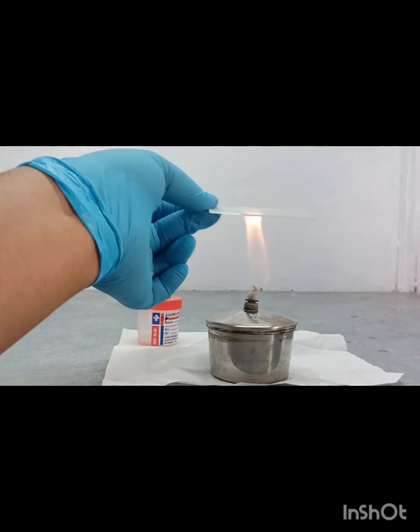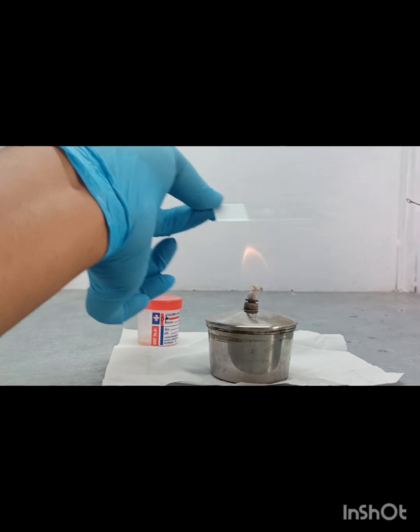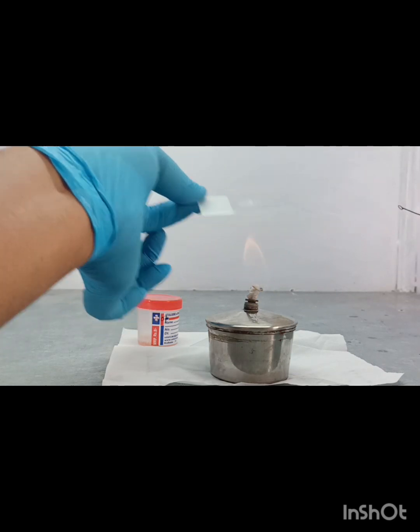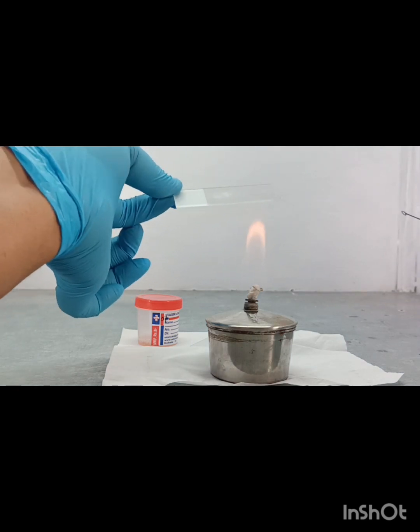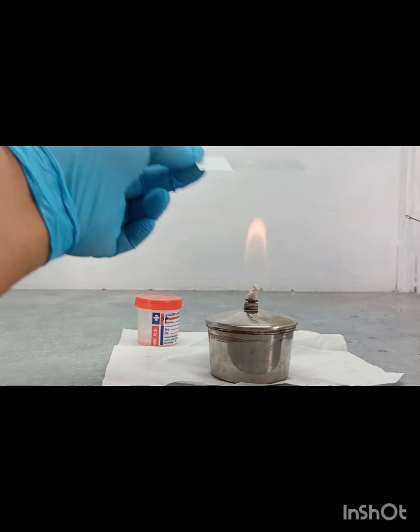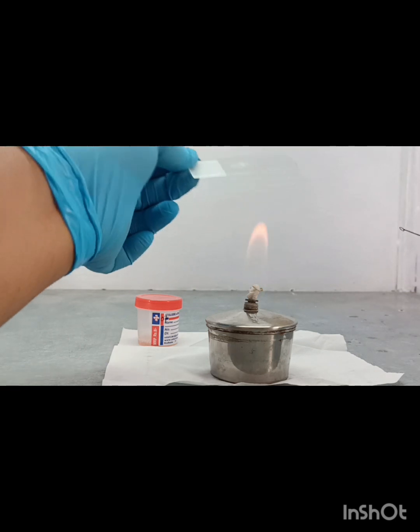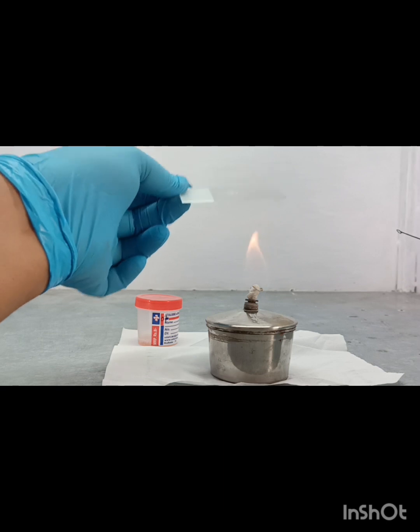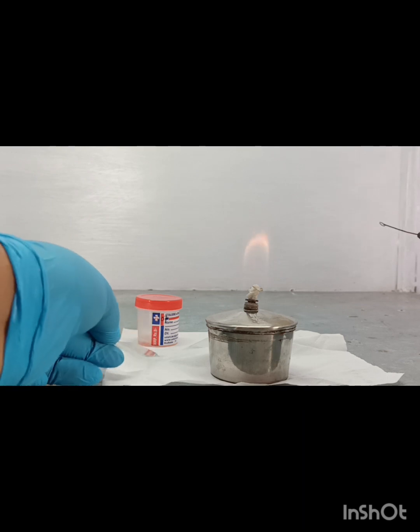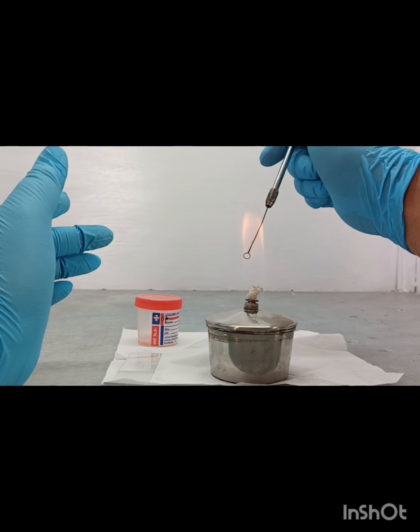After preparation of the smear, heat fix it gently. The reasons for heat fixing are, one, decontamination, and another, that the mucoid part of the sputum or any other clinical sample gets easily attached to the glass slide. So at the time of washing, it never washes off from the glass slide. After that, we again sterilize the nichrome loop.